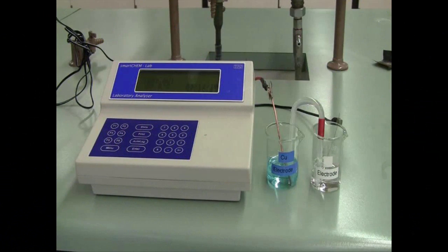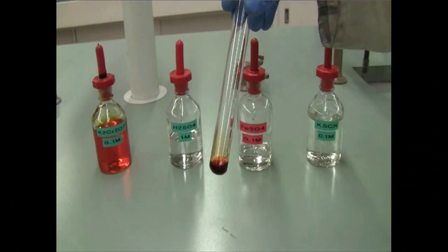In this experiment, you'll be investigating the effect of changing the concentration of one of the two solutions on the cell potential, and you're then going to use a cell potential measurement and combine that with theoretical half cell potentials in order to determine the identity of an unknown electrochemical half cell. So looking back over the prac, what can you do to make sure you come prepared for this experiment? First of all, make sure you've had a read of each of the 4 different theory sections for this experiment. So for your different reaction types and for your redox reactions. And then for each section, try and get started on some of the work before you arrive.